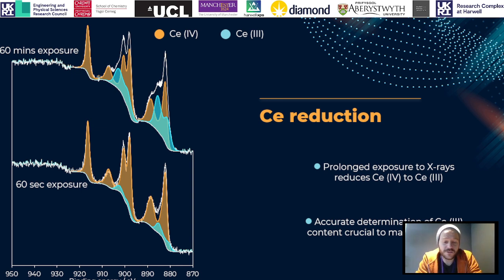Now on the bottom we've just got a very quick scan of just a commercial Ceria we brought in, small amount of Cerium 3+, but mainly Cerium 4+. If we actually leave the X-rays on for 60 minutes, you can see we form a huge amount of Cerium 3+.